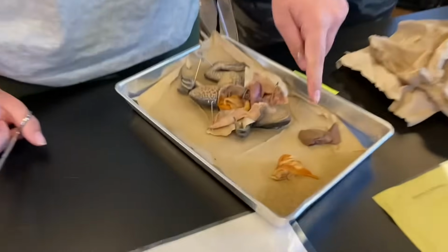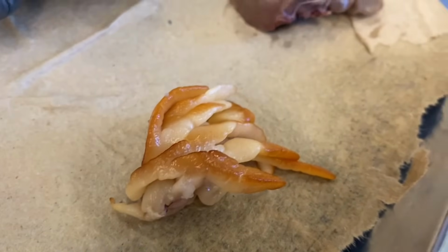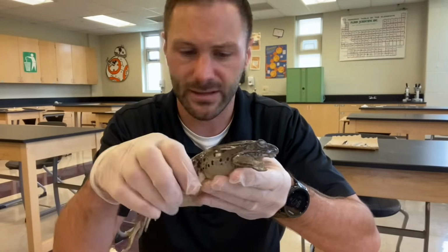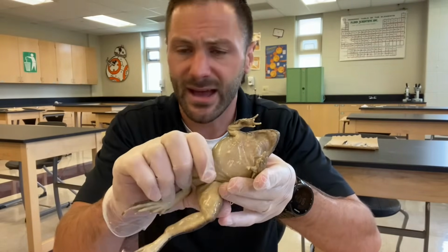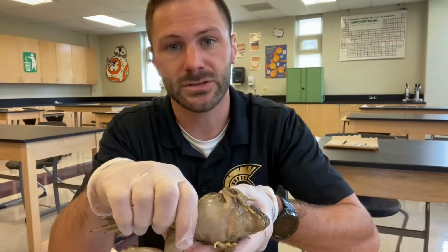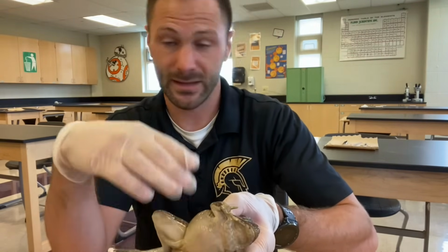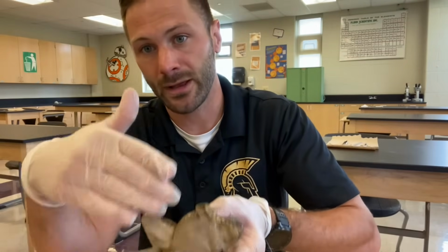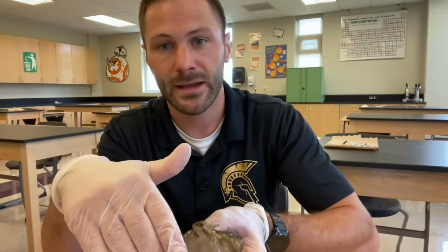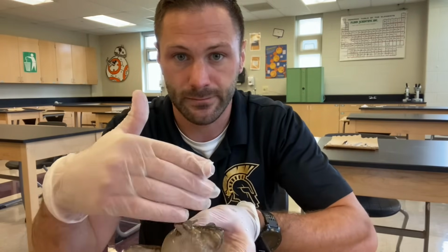But another thing you see are fatty bodies, okay? They're these kind of yellow, stringy, floppy bodies that are inside the frog itself. And that is just extra energy storage. When we overeat, our body stores fat because it says, I don't need this right now, but I'm going to save it in case there's ever a time where I'm low on energy. I'll start burning fat in order to make energy so the organism can actually survive. It's an efficient way of storing energy in our body.